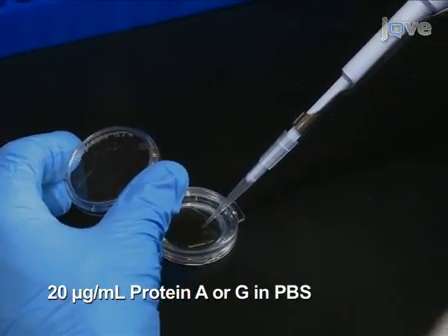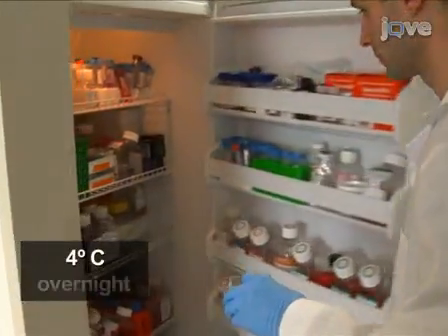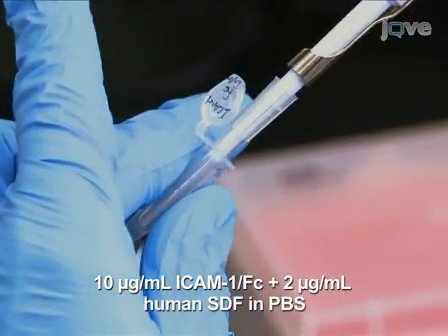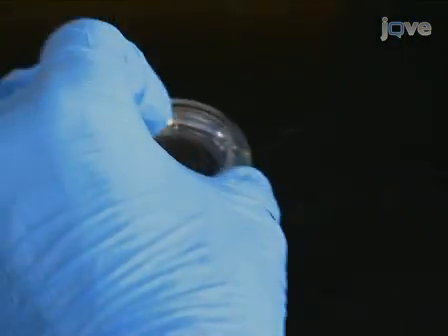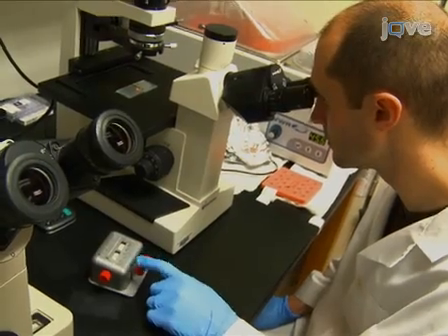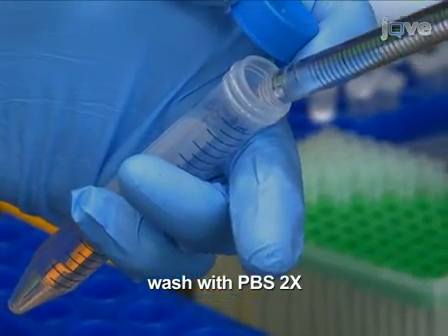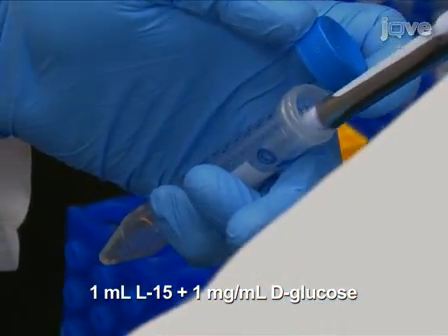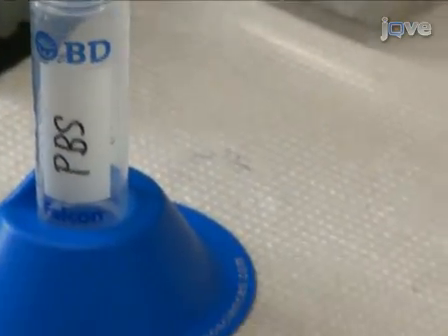One day before the migration assay, coat a glass bottom 0.17 millimeter dish with 20 micrograms per milliliter of protein A or G in PBS. Incubate overnight at 4 degrees Celsius. The next day, wash the dish extensively with PBS. Then add ICAM-1-FC and human SDF-1 in PBS solution to the dish. Incubate for 4 hours at room temperature to immobilize the molecules. Determine the density of the cultured cells using a hemocytometer. Then wash T-lymphocytes twice with PBS and resuspend them in 1 milliliter of L15 media containing D-glucose. Following the incubation, wash the coated dish with ICAM-1-FC and SDF-1 extensively with PBS.